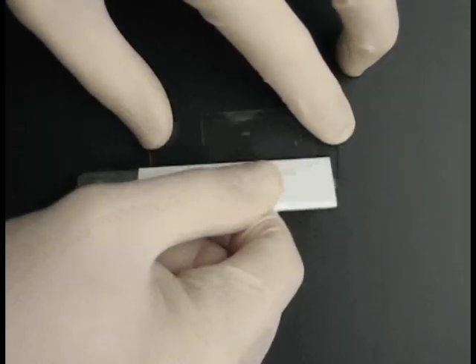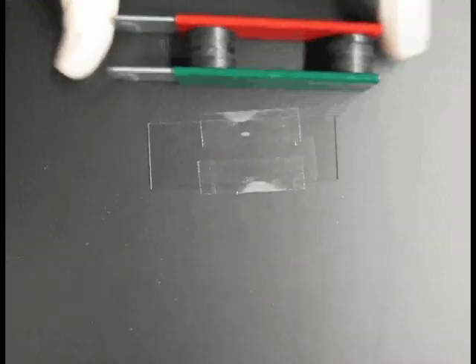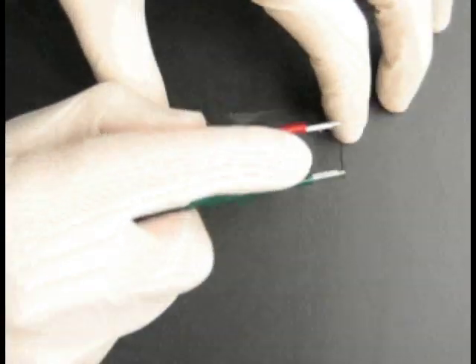Next, I use box cutters to remove excess tape. The box cutters I use are stuck together by some spacers. They are positioned such that they are approximately the same distance apart as the cover slips used.